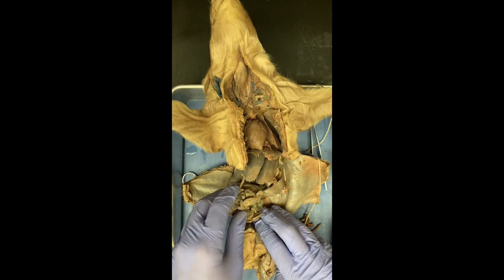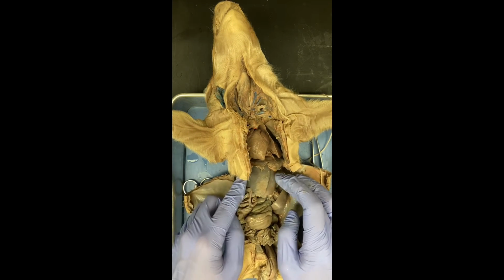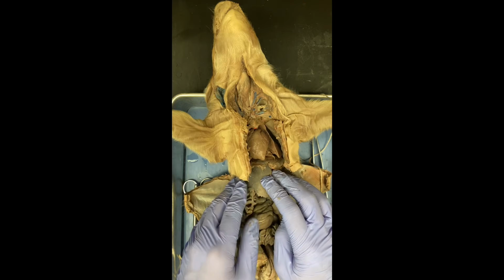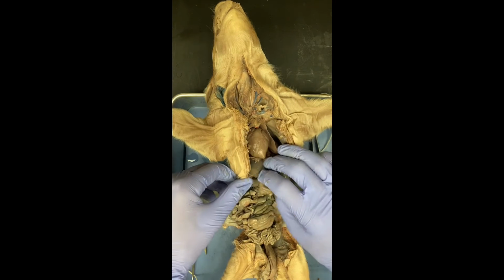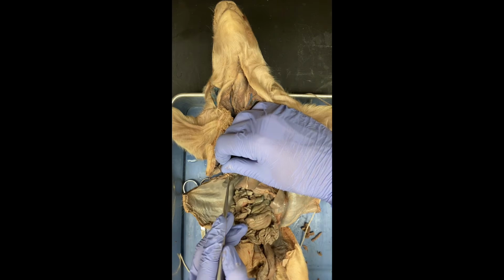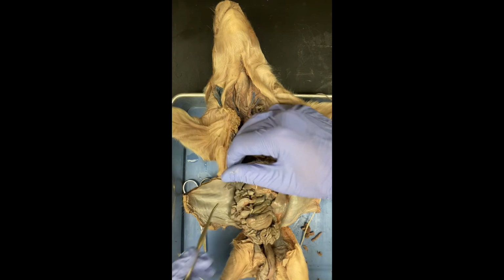The next is the liver, which, as in most animals, is going to be really large. This is the liver, all of this. It processes the toxins in blood and also creates bile. And the bile that it creates is stored by the gallbladder, which is going to be hidden under here. This is the gallbladder. Let me grab my probe. It stores the bile created by the animal. You can see it's a little bit of a looser sac compared to the liver, which is a bit harder.